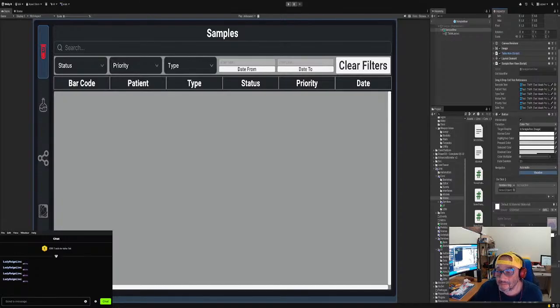Added to LIMS. Okay, so we got LIMS, services, LIMS events. Let me see. No, that's not services. LIMS events. What did I put that thing? Events. There we go. Oh, that makes sense, right? In the folder that says events.